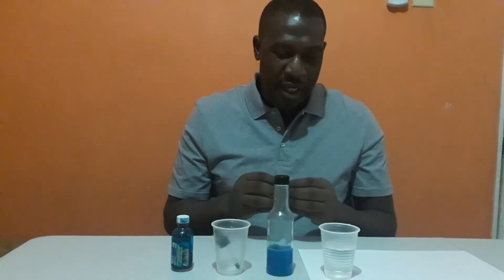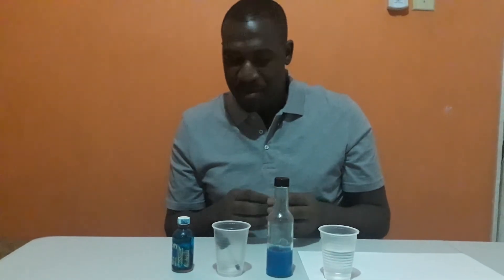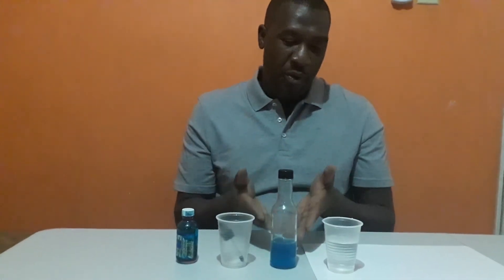Now, I'm going to allow this to stand. In a while, you'll start to see that the two layers are separating, because the oil is immiscible with the water and they have different densities. The oil will typically have a lower density and will float towards the top, while the water will form a lower layer.